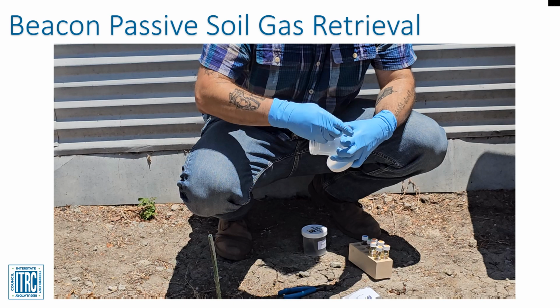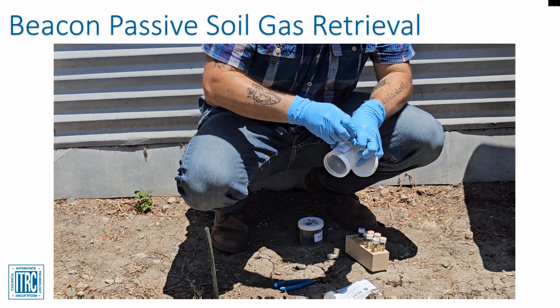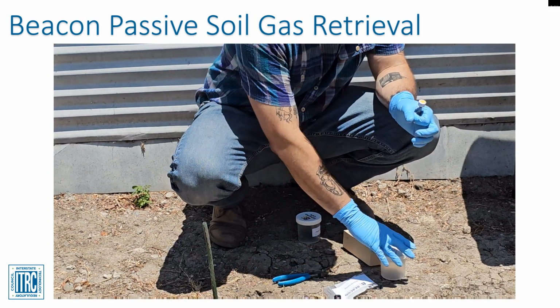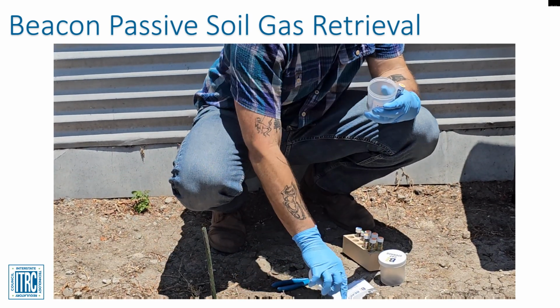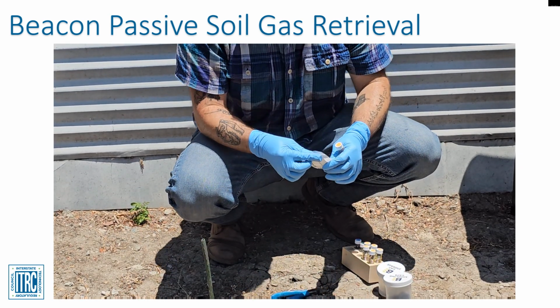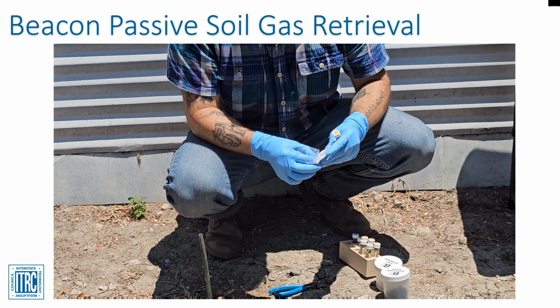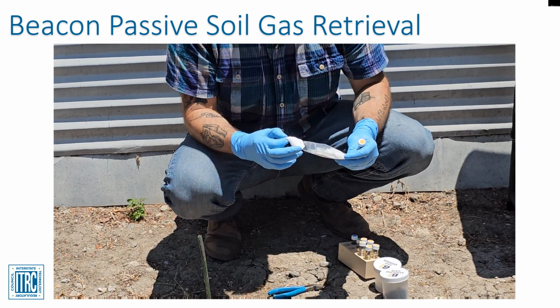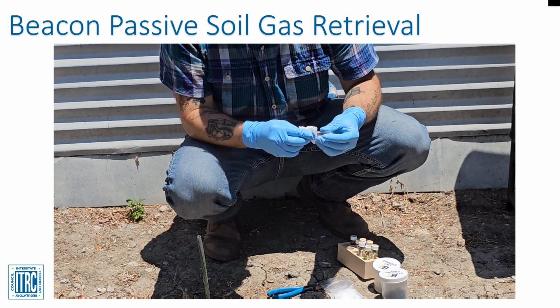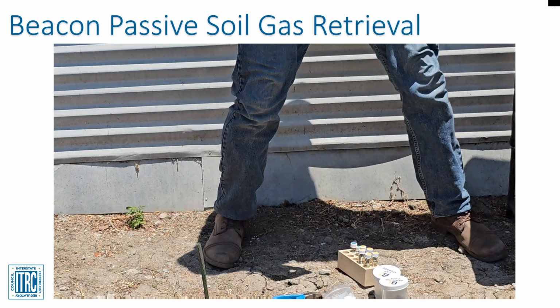Once retrieved, the wire is removed, and the sampler is wiped clean using a clean cloth rag or paper towel. Next, the open cap of the glass vial that has an opening is replaced with a closed cap, and the sampler vial is labeled with the sample location ID and returned to the Beacon sampling kit. For labeling, use a ballpoint pen. The field personnel should make sure they log all collected samples onto the chain of custody. Note that for field duplicates, Beacon can analyze the second pair of adsorbents for a sampler, meaning each sampler includes its own duplicate.